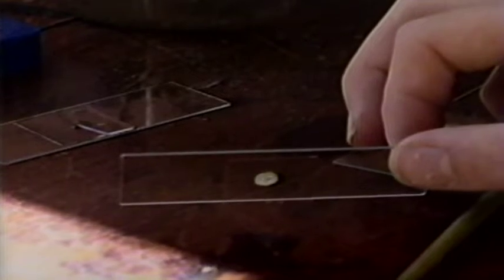Prepared slides are made from materials which have been dried, stained, and permanently mounted to the glass so they can be used as convenient samples over many years. Many prepared materials are thinly sliced to allow light to pass easily through. Slices, called sections by microscopists, can be obtained in several ways, and each results in a different view of the material.